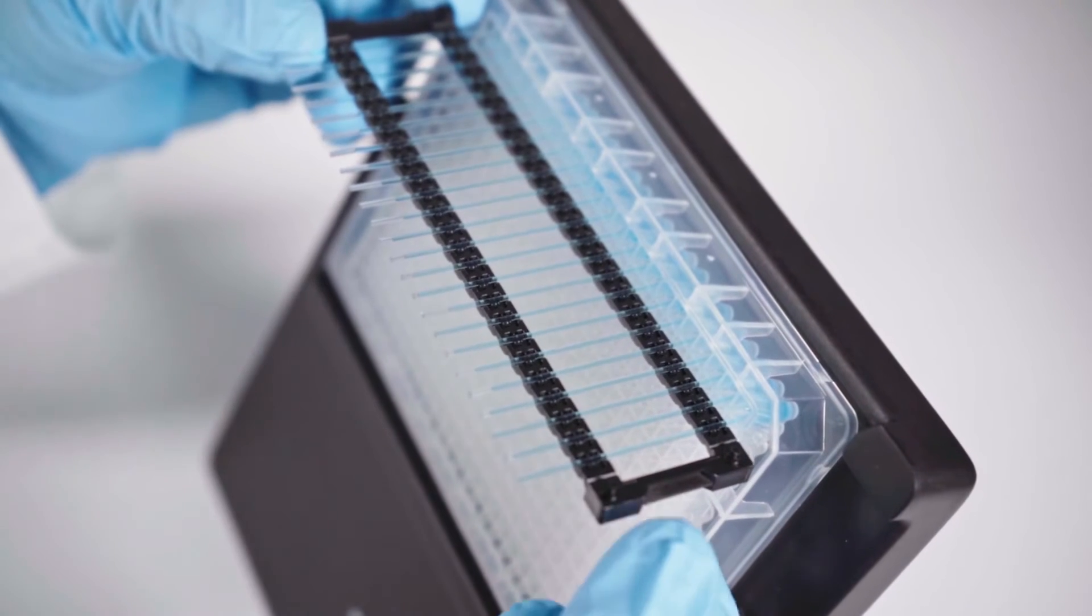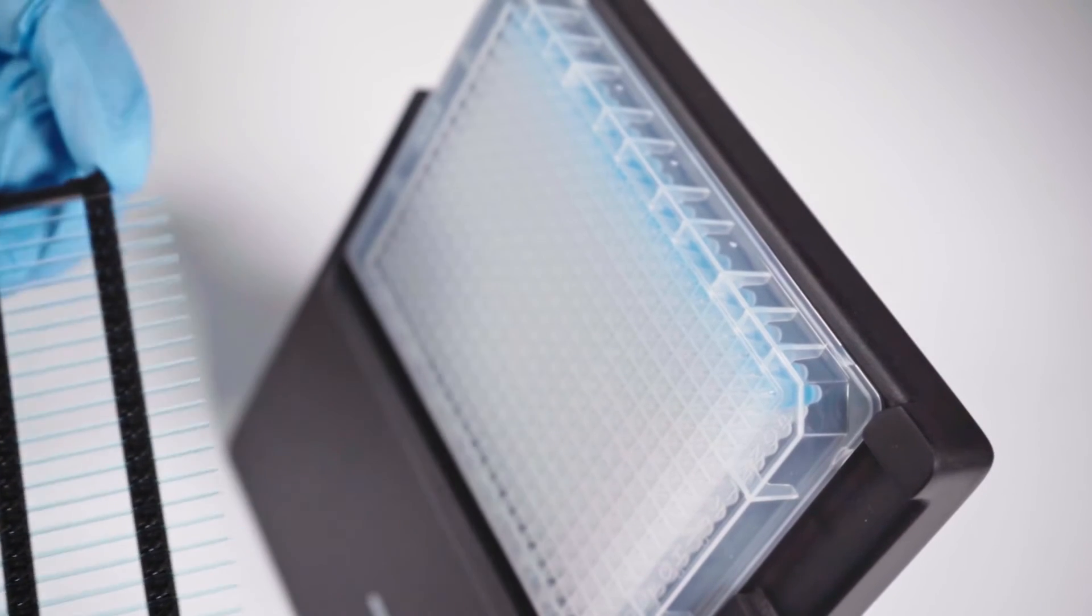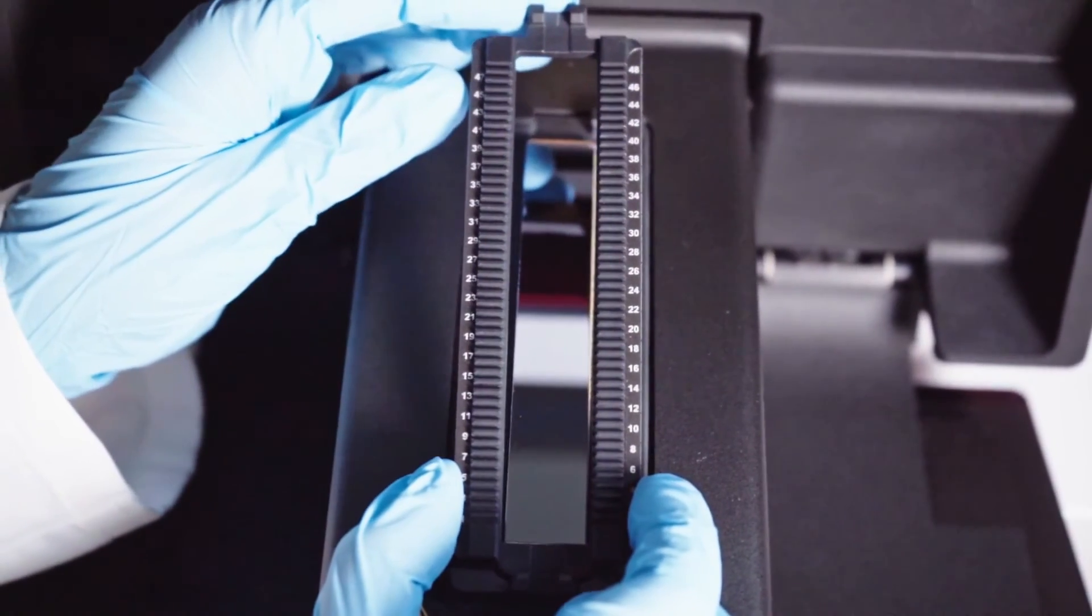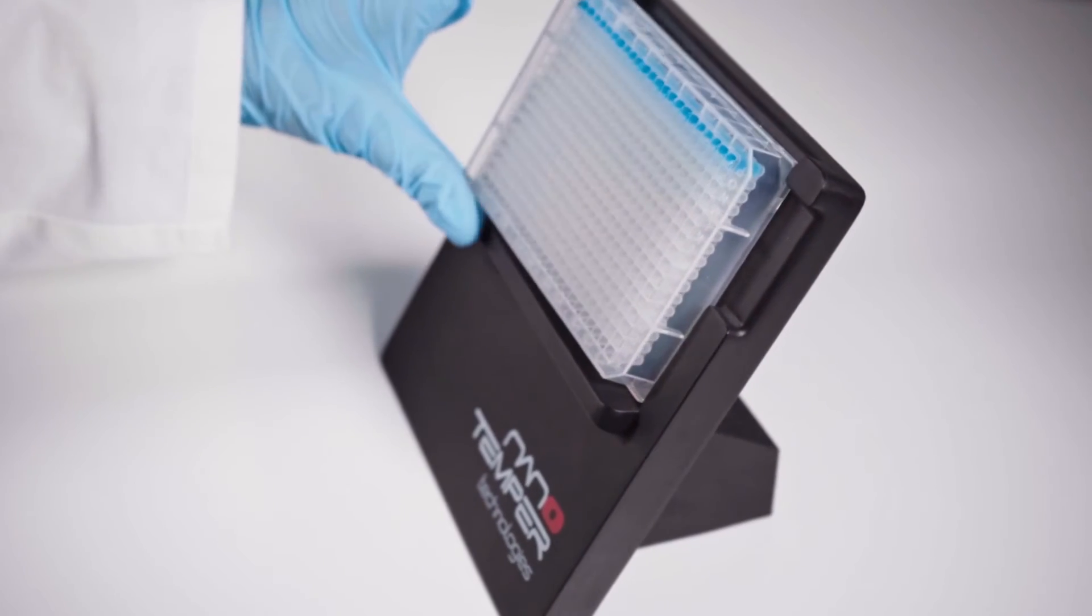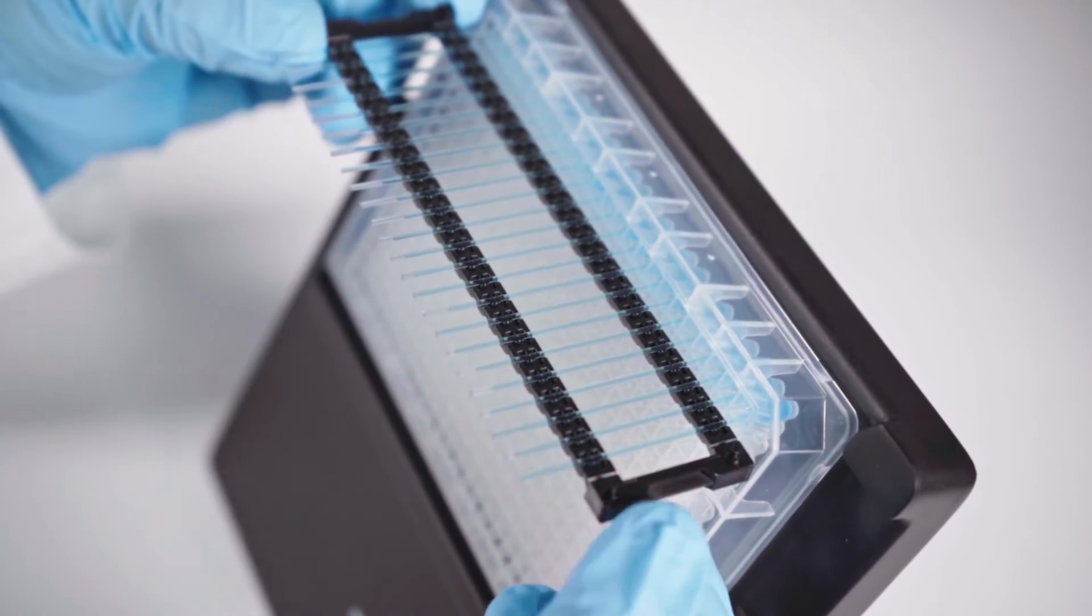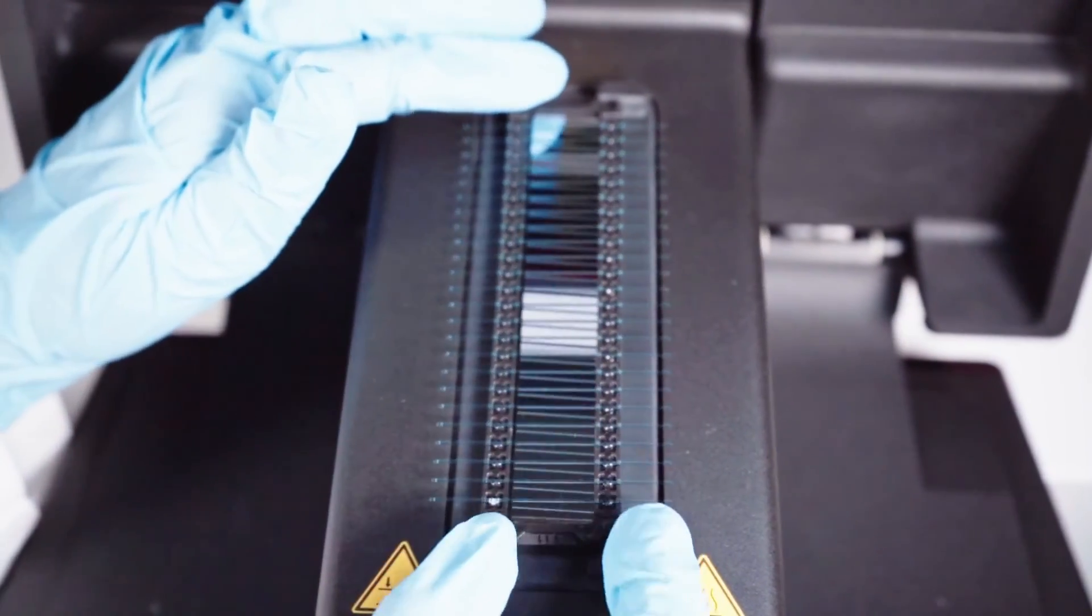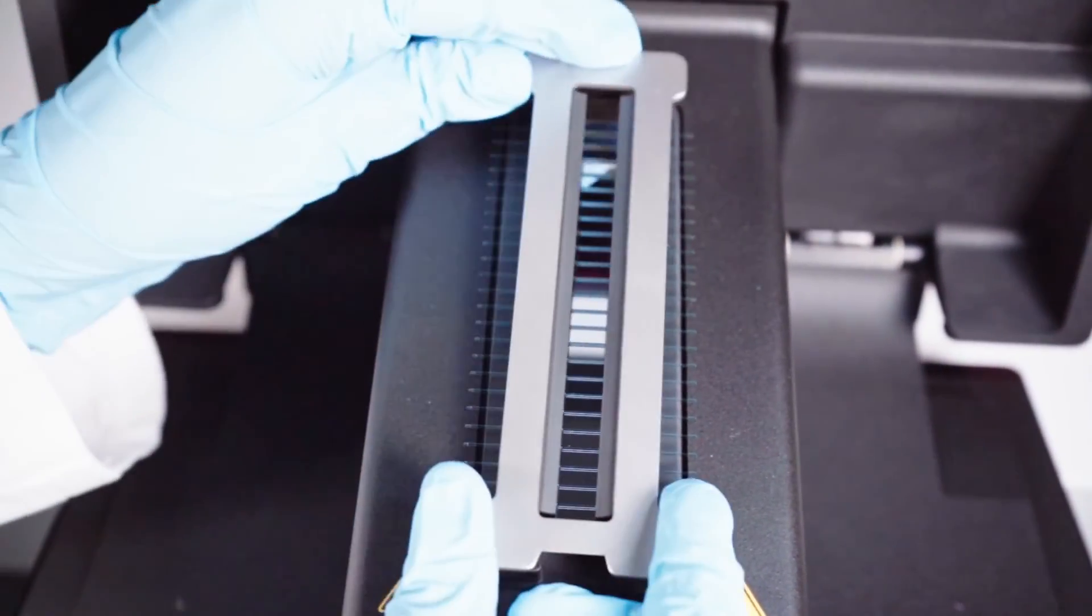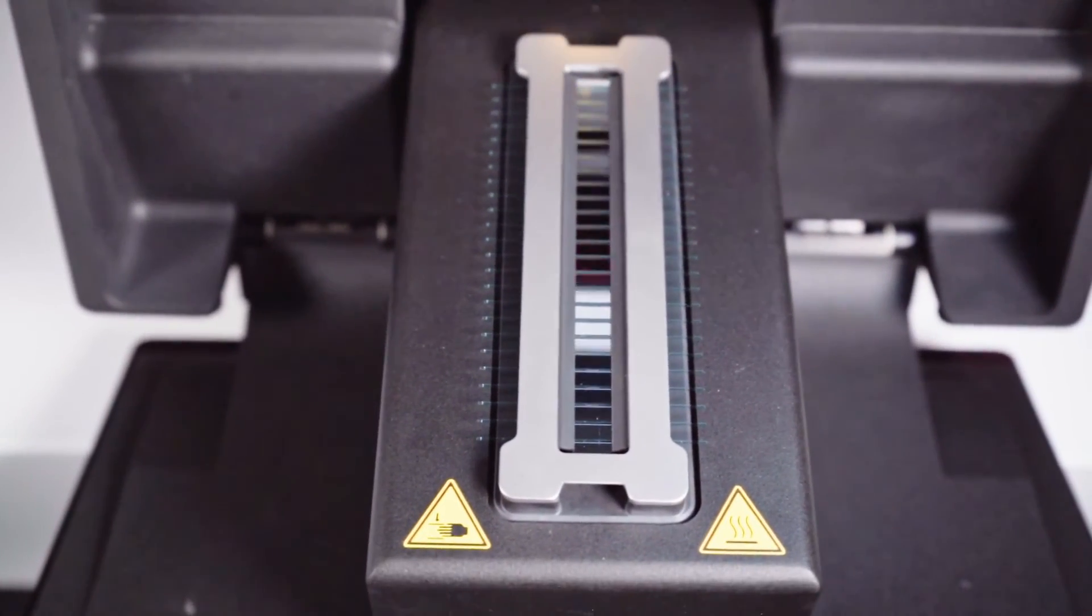For higher throughput or if you already prepared your samples in well plates, the capillary chip is designed for faster loading. There are 24 capillaries on the chip and they are spaced to match specifically a row on a 384 well plate or you can load duplicates on 96 well plates. To start, remove the single capillary adapter, then you can put your plate on the capillary loading station and you can draw the sample in. Place the chip on the capillary tray and secure it with the lid. Then you can close the door and you are ready to start.